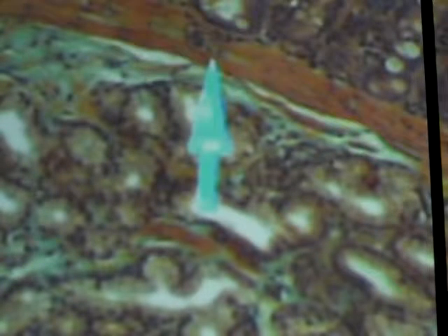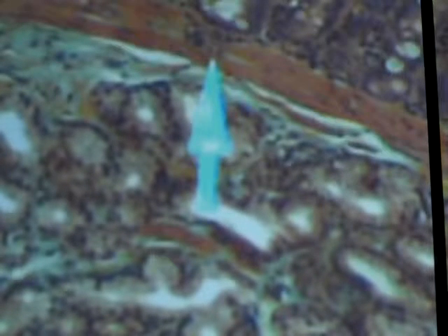There are only two places where you're going to see glands in the submucosa. We have the duodenum, and where else? Remember before? So move back upwards. The esophagus. So if you're seeing glands in your submucosa, it's either the esophagus or the duodenum.